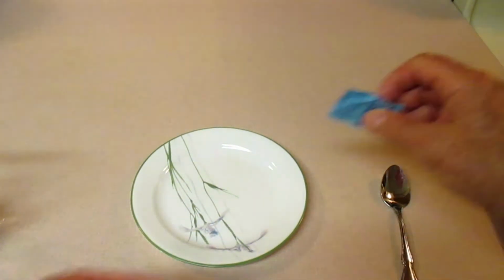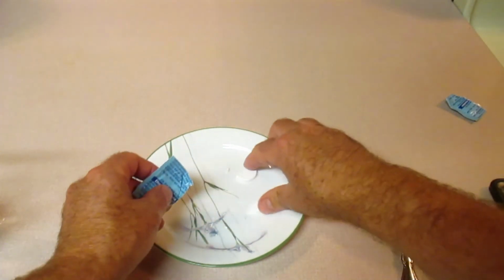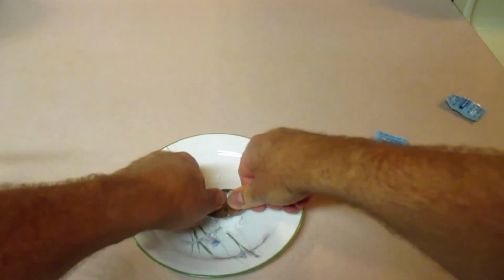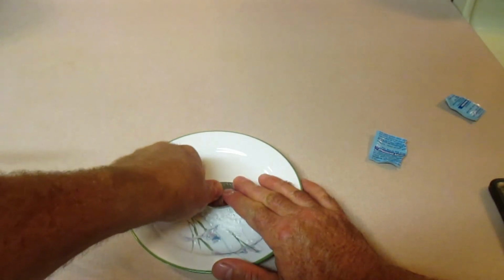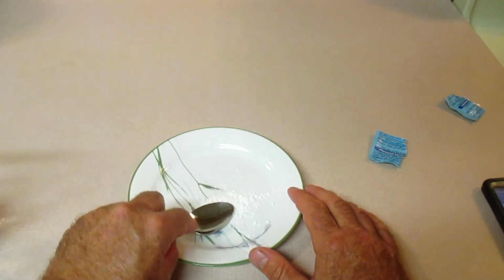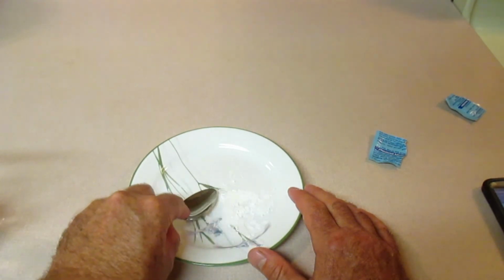Alright, I'm back now. This is the last portion of this experiment, and what we're going to be doing here is taking an Alka-Seltzer tablet and pulverizing it. I'm going to use a spoon. You can use a hammer, whatever you want to use. I'm just going to take a spoon and break this up into the smallest pieces. So in the first part, we looked at very large samples, right? And that took about just under 34 seconds for me the last time I did this. Alright, and so now I've got this broken up to some really fine dust.